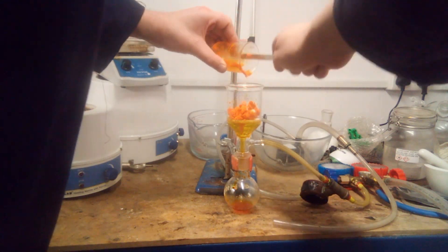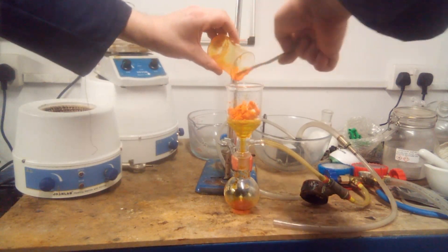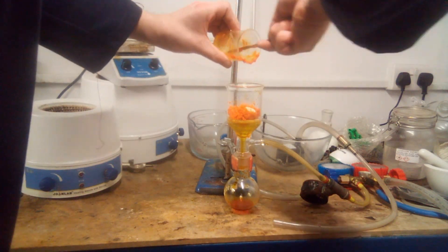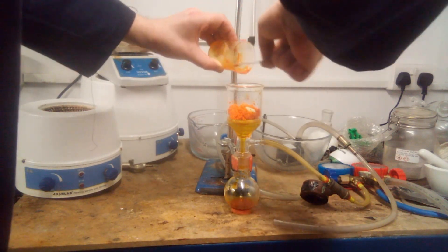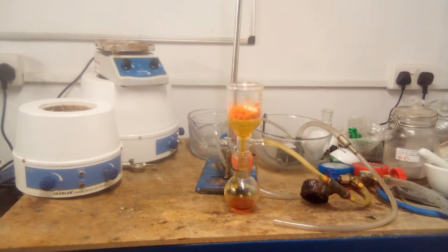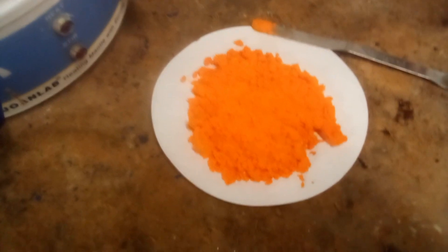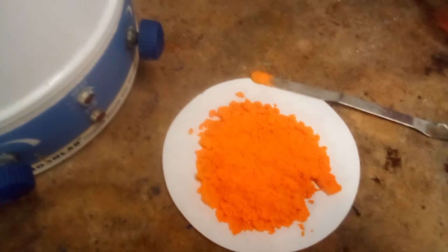It's worth noting that in previous attempts I tried to dry the mixture by boiling it dry or by vacuum distillation of water, and I found out the hard way that PCC is not thermally stable. When I tried to dry the product by heating it to 125°C at atmospheric pressure, the entire batch was destroyed, leaving only wet brown sludge that was mostly chromium trioxide and water. The vacuum method also failed, as the heat caused partial decomposition to chromium trioxide, which is very hygroscopic. The final yield was 17.65 grams of slightly damp, fine, bright orange powder, representing a yield of 82% with respect to chromium trioxide.